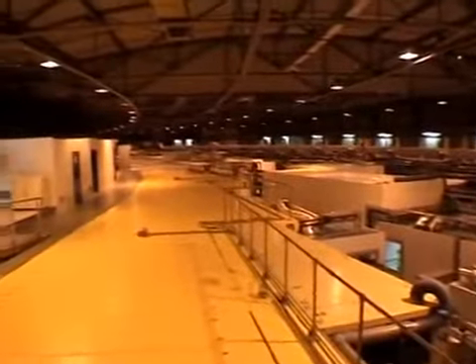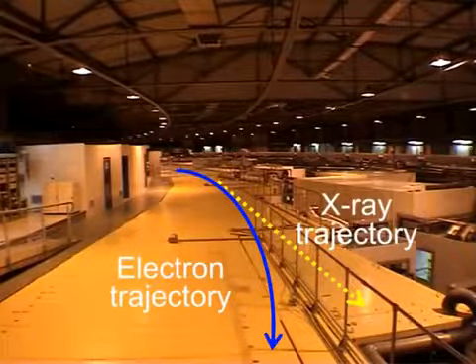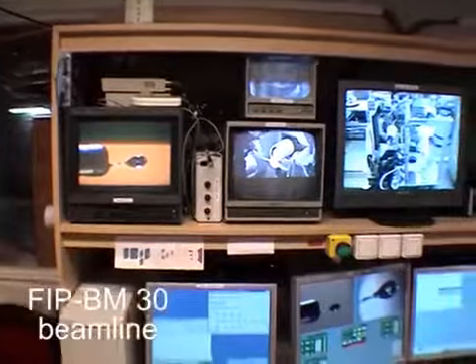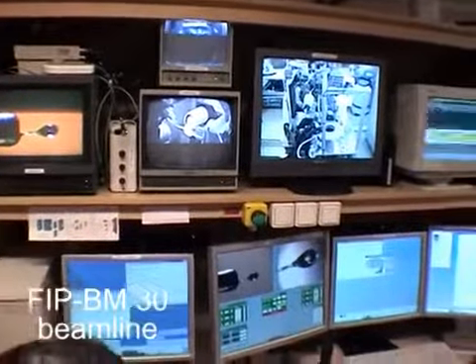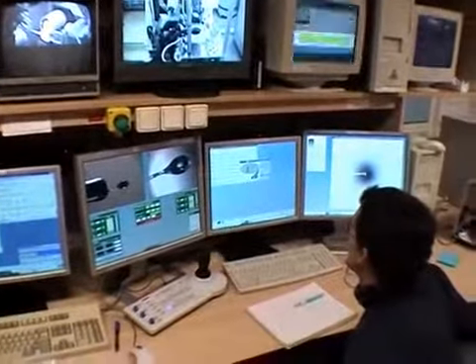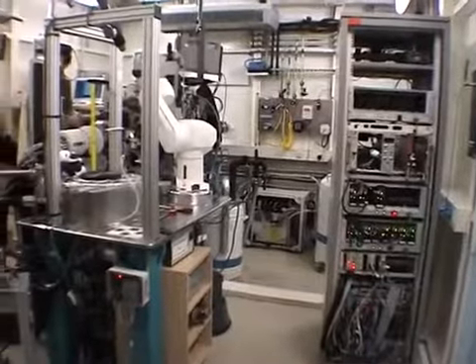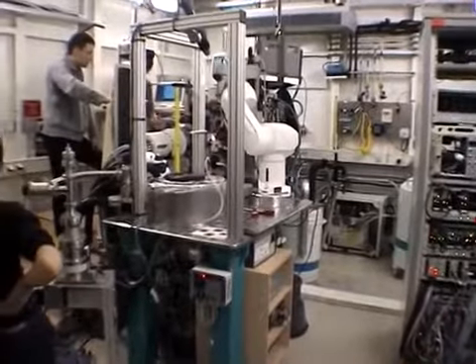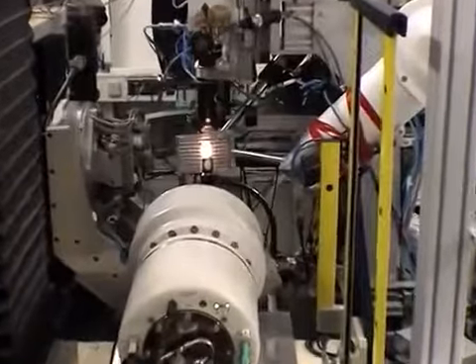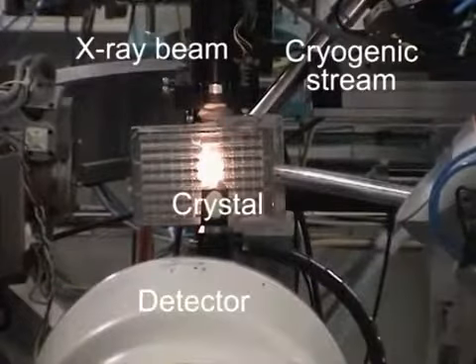Different types of rays, including the very intense X-rays which interest us, are produced by packets of electrons which circulate in the central ring. These rays are collected and used in experimental hutches in different locations around the ring. Here is the control room of one of these areas. The sample is placed inside the hutch between the detector and the arriving X-ray beam.